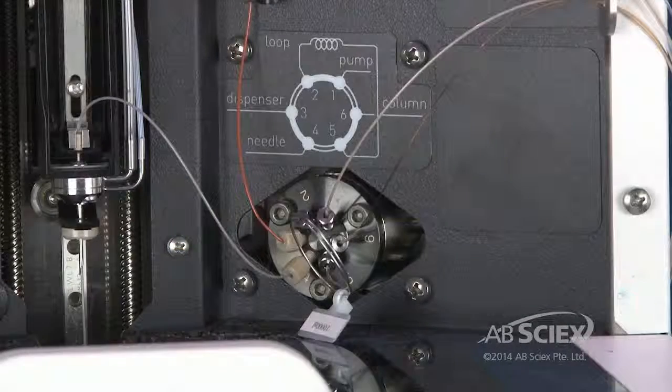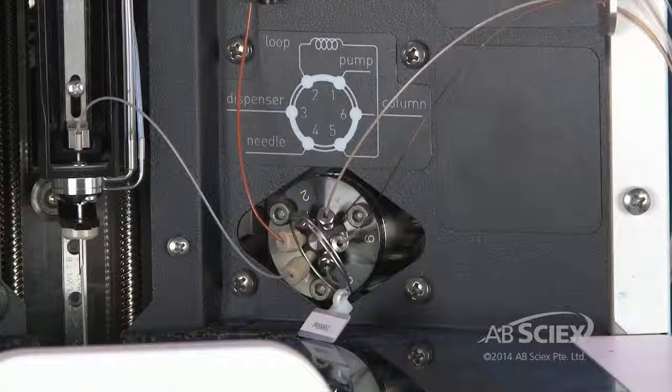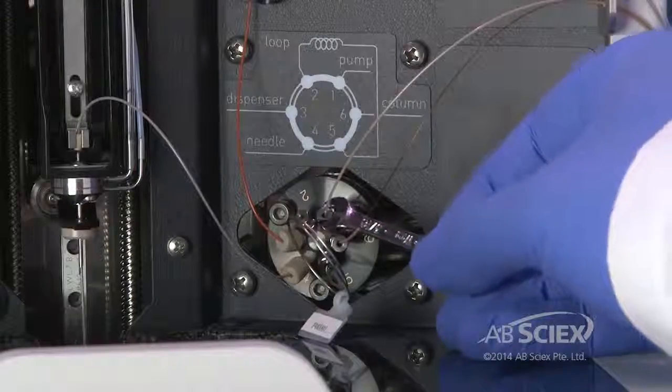If either of these parts is damaged, then aspiration or sample delivery issues can occur. To remove the stator and rotor seal for cleaning or replacement, remove all fittings from the valve.